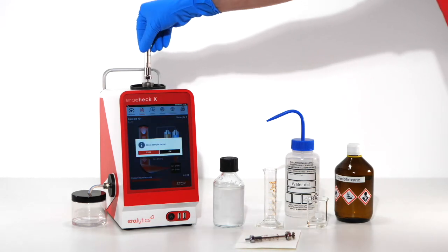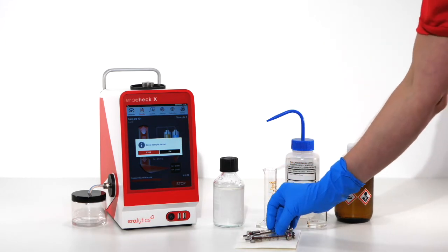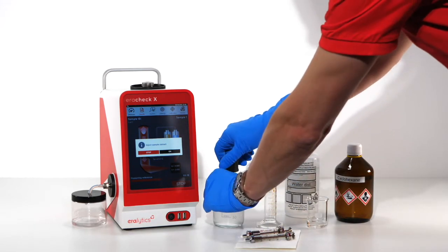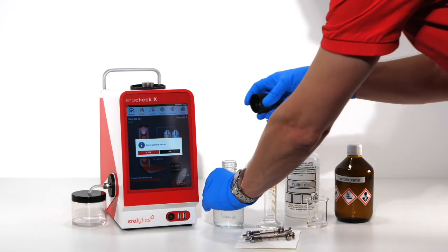As soon as the phase separation is completed, add distilled water until the cyclohexane phase can be conveniently reached with the sample syringe.